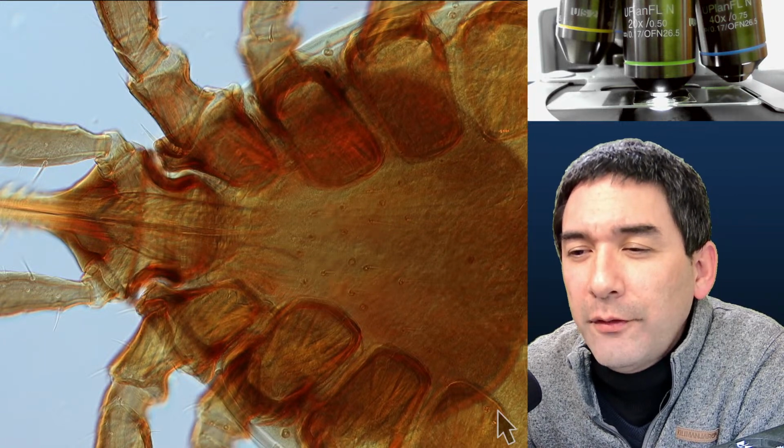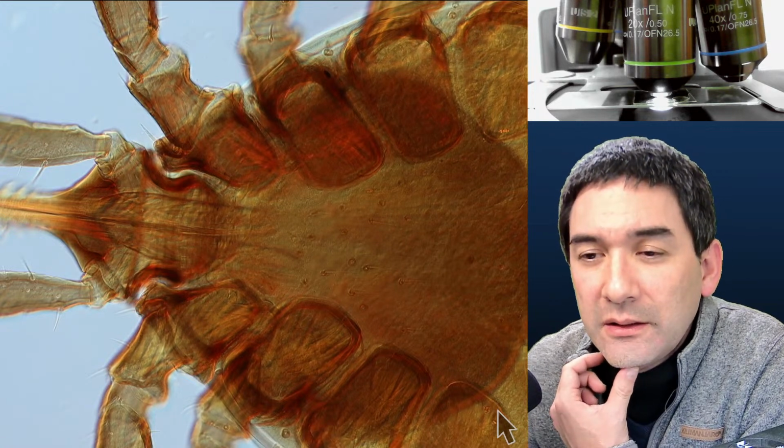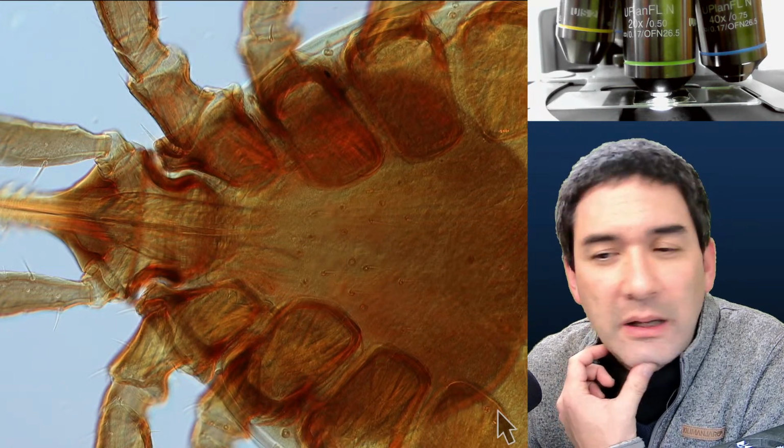Is a silverfish the same as a paperfish? I have not heard of the term paperfish yet. Okay, so I don't know about that.